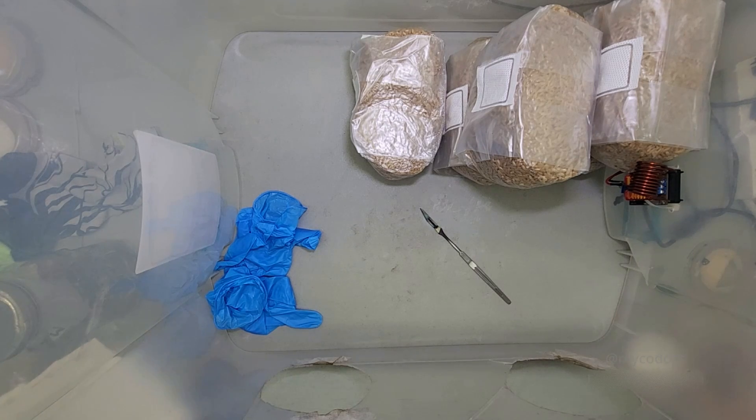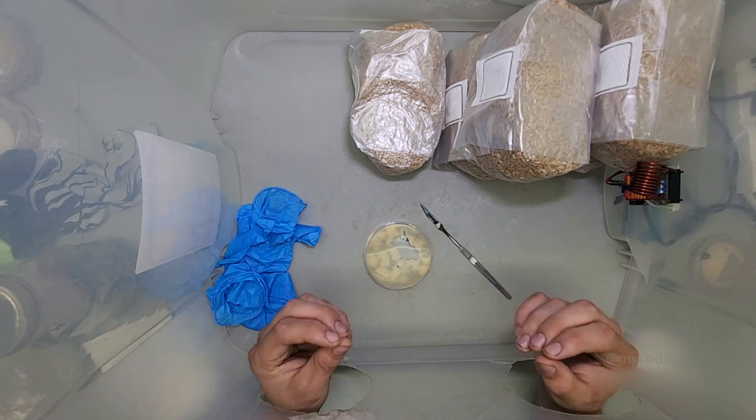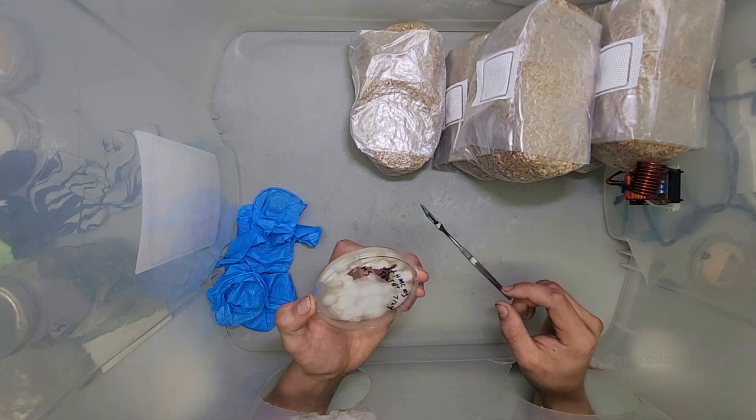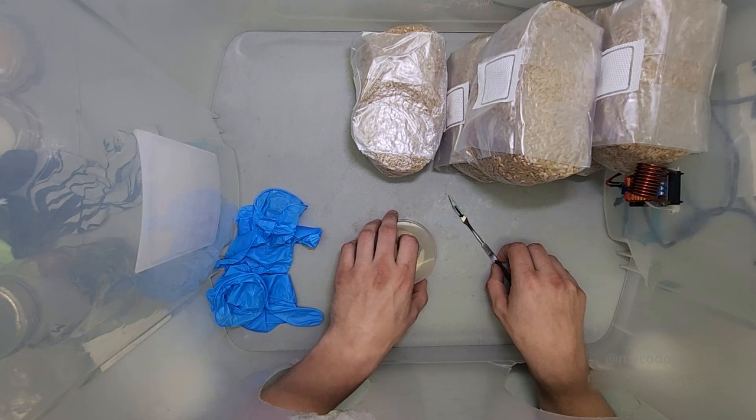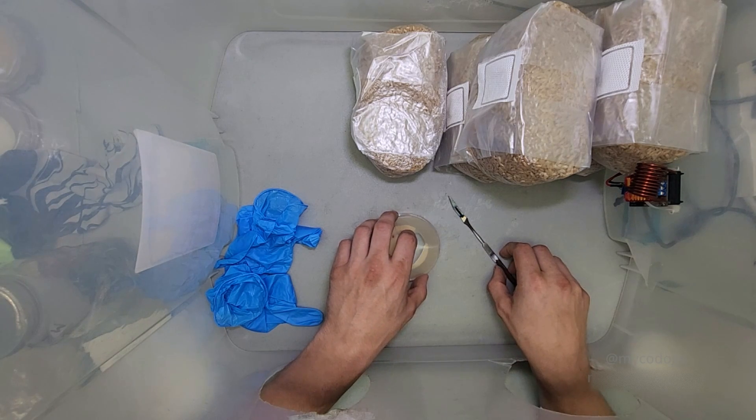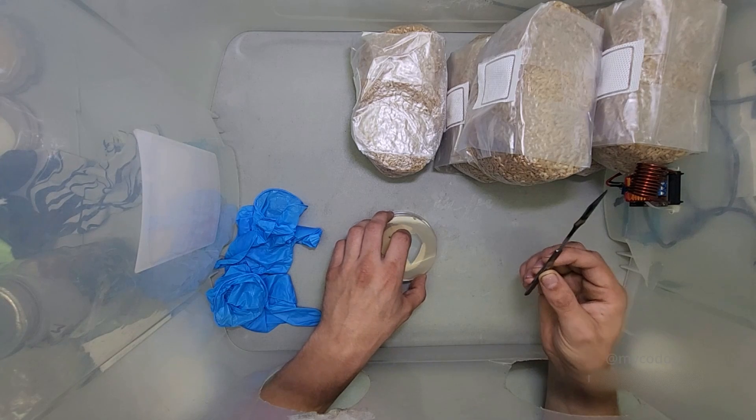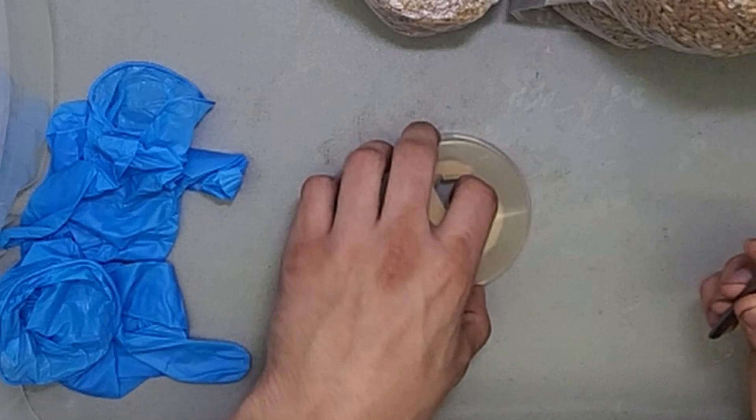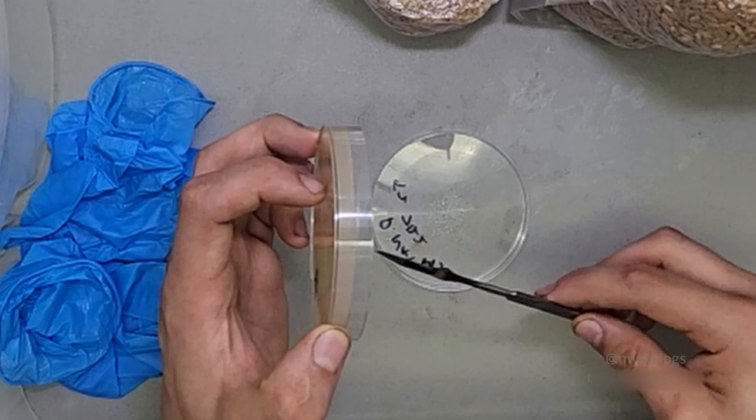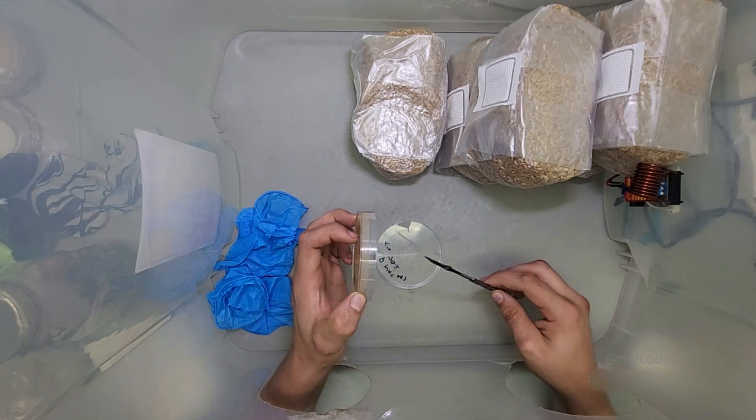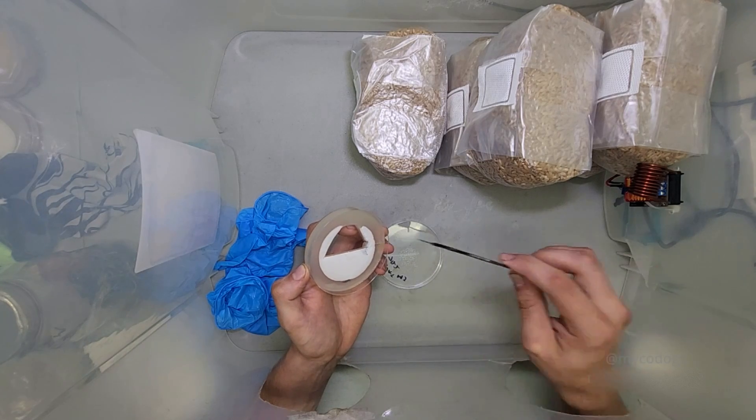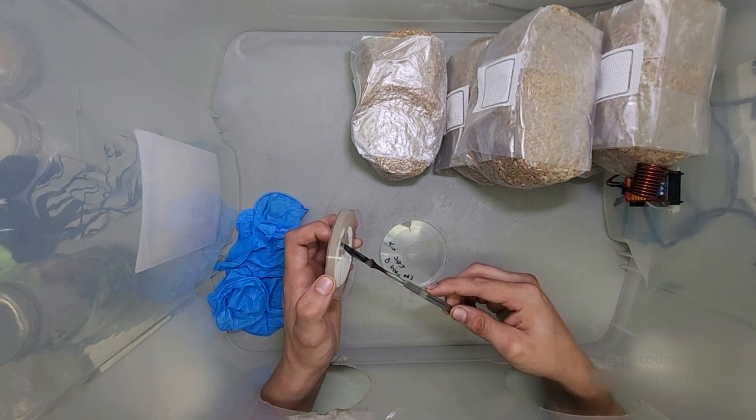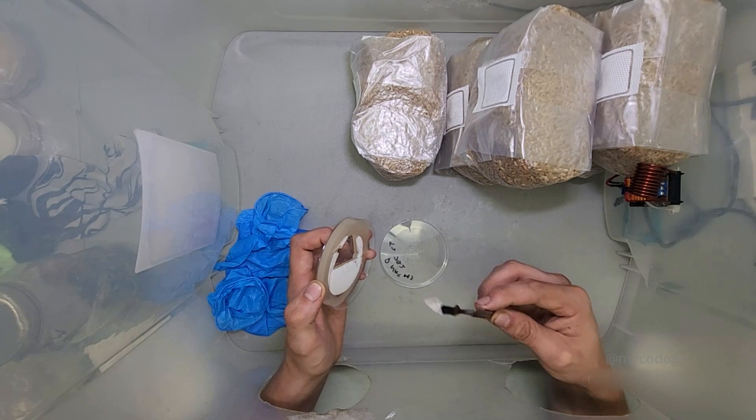I'd like to discuss working with agar plates now. One of my favorite techniques, which you'll see me using a lot in my videos, is opening the plate upside down. There's multiple benefits to opening the plates upside down. The first and most obvious one is that it's much easier to do with one hand. When you'll notice how I have it at a slight angle facing towards the ground. I never really want to have it at this angle facing up because that would allow contamination to fall onto the dish. Facing slightly down, hold the tool at the base, and then take your transfer.